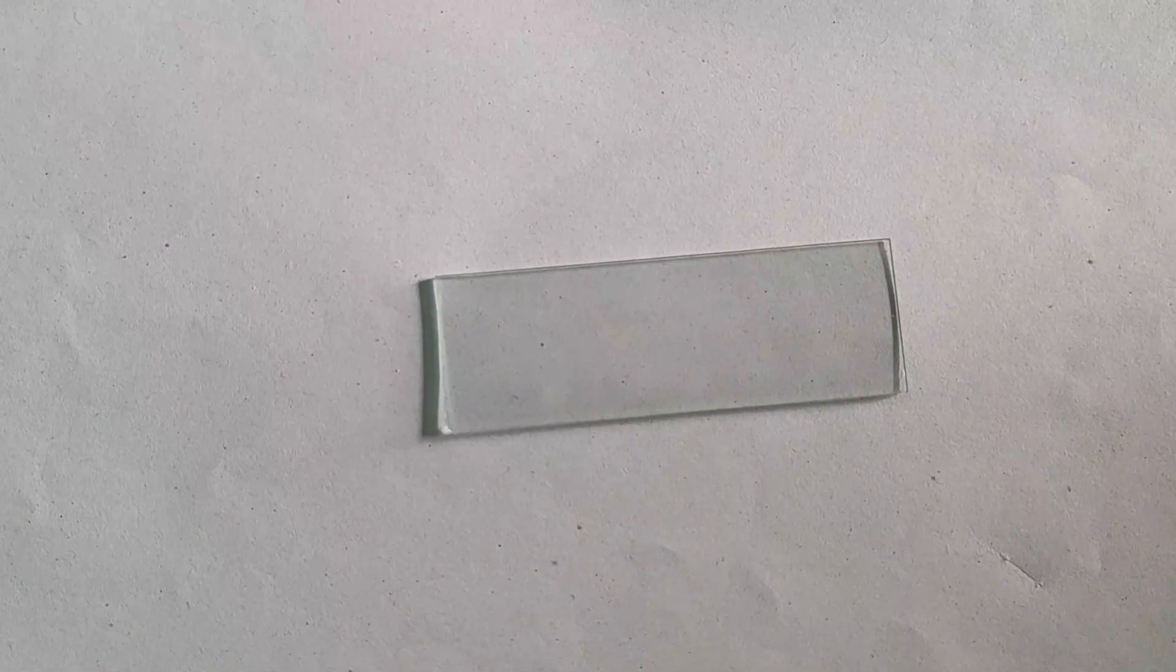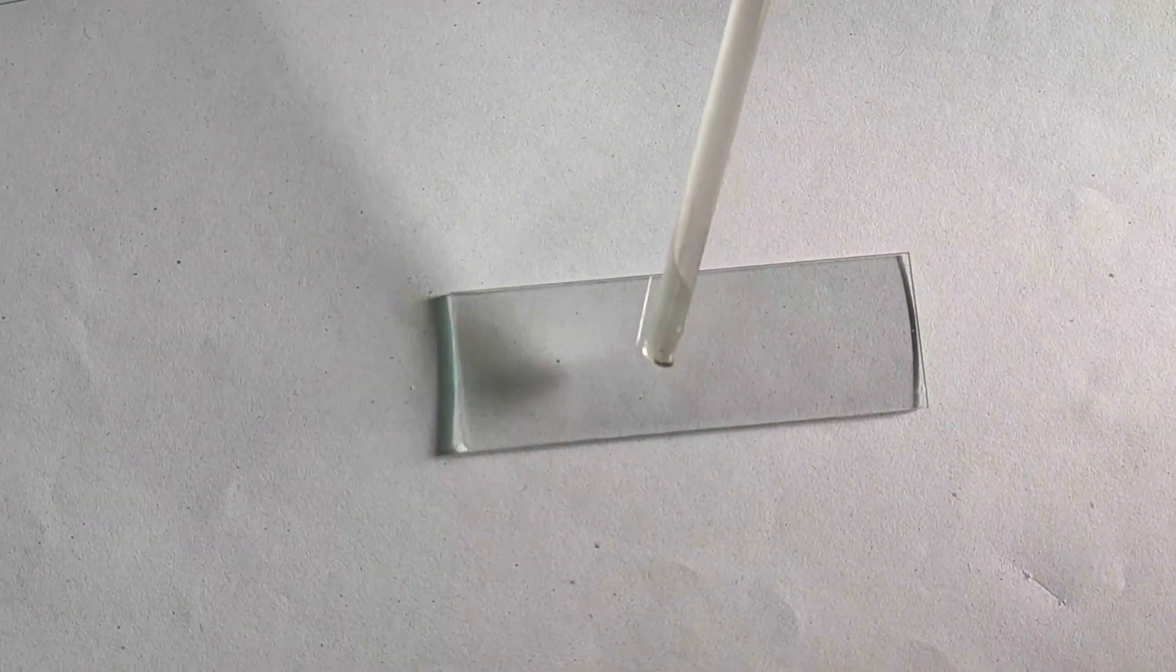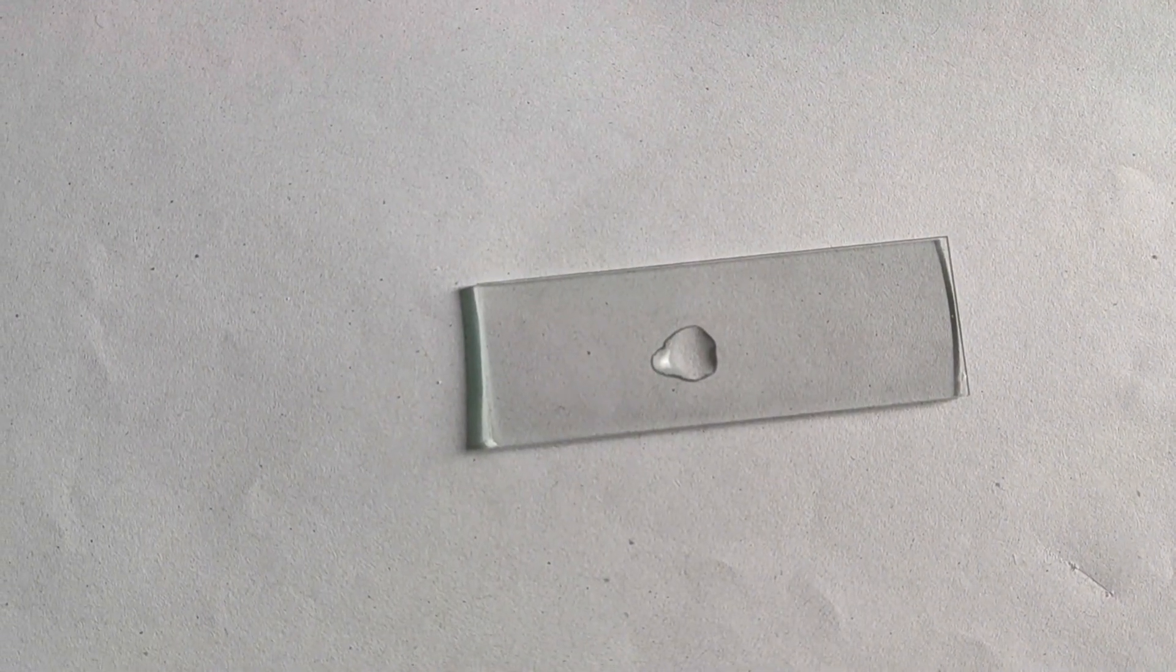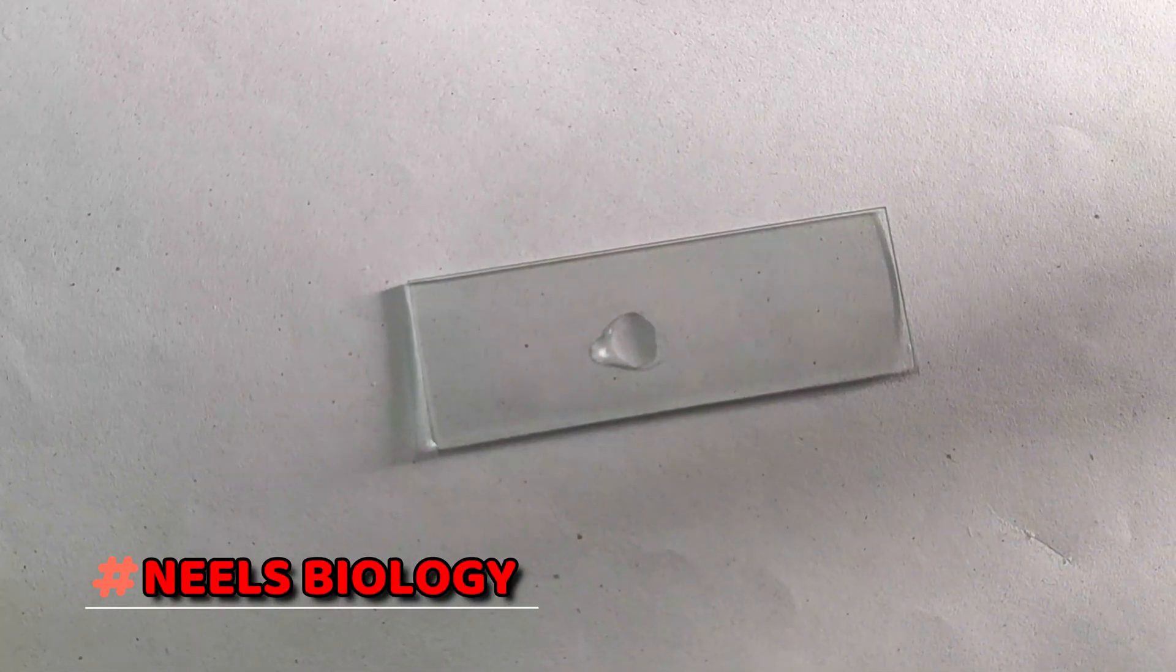After this, we'll take a drop of methylene blue stain, which helps to increase the visibility of the cell.